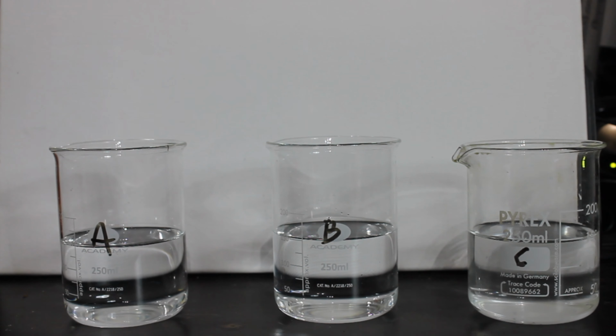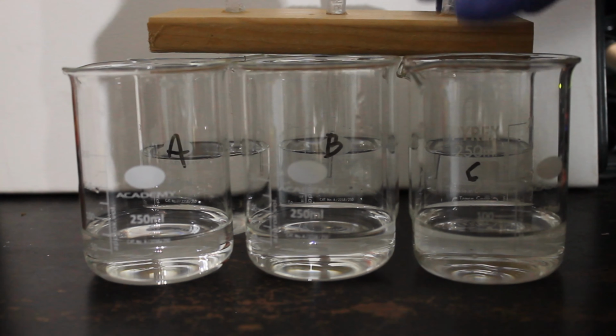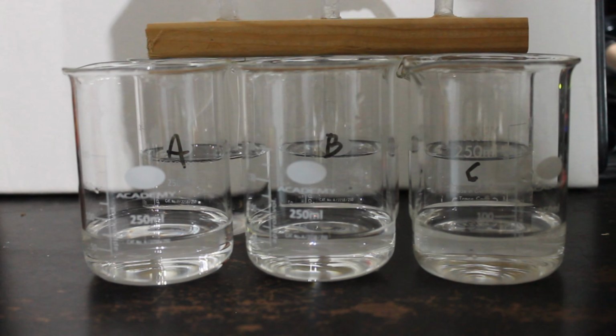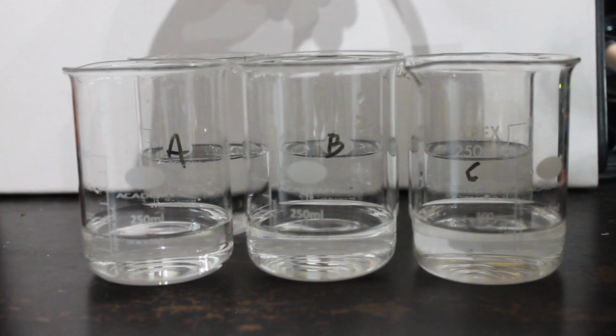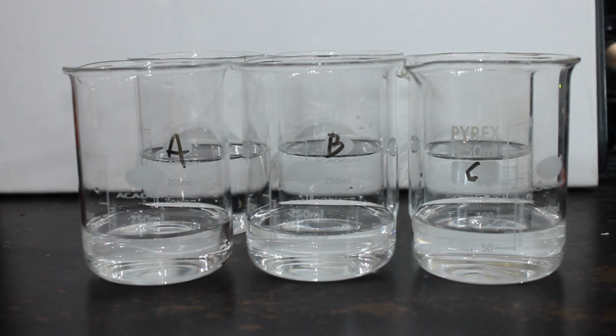In this video, the original plan was to set up 3 different chemical clocks, changing at the exact same time in 3 different colours. This was to be an example of a Landolt's clock. However, nothing happened.